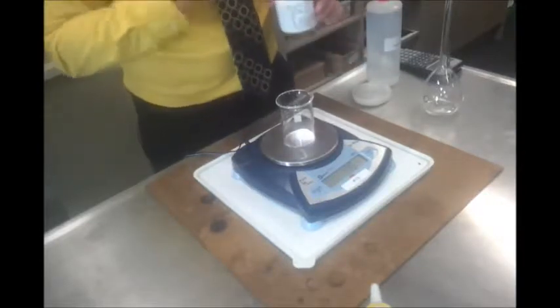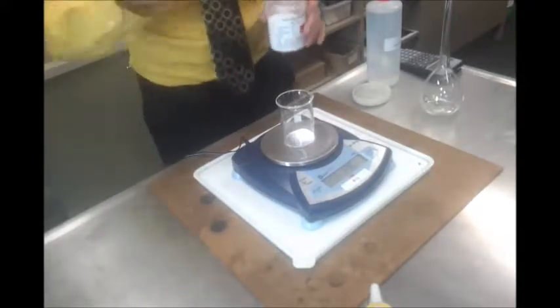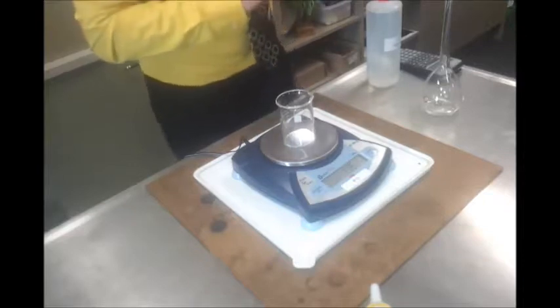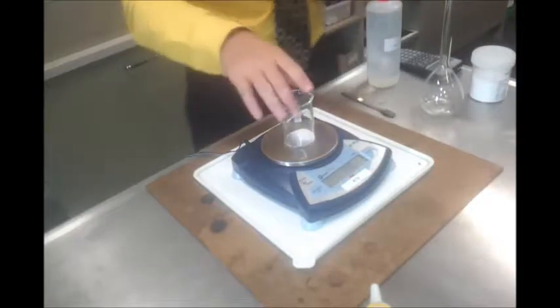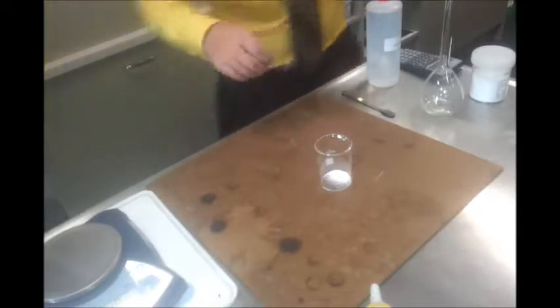Now I may not get 1.32, may go a bit over, but I'm not too worried, to be honest. Yeah, 1.36. It's close enough, honestly. I'm not going to spend heaps of time trying to get it precise. As long as I don't go to 1.4 and don't stop at 1.25, then I've got enough in there for the experiment. Okay, just believe me on that one. Then I'm going to take this off the scales. So the scales are going to one side. Having recorded that 1.36 grams in my book.